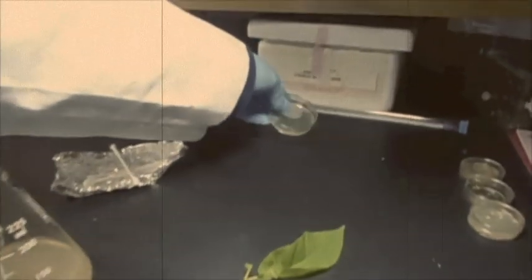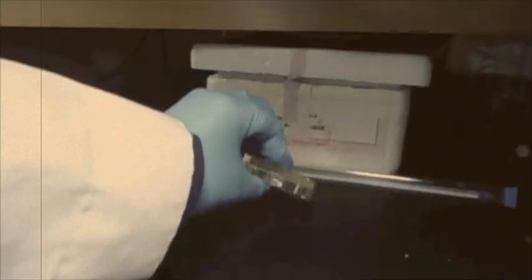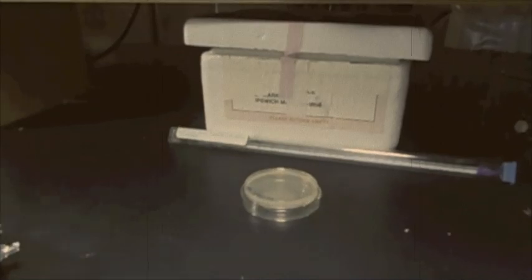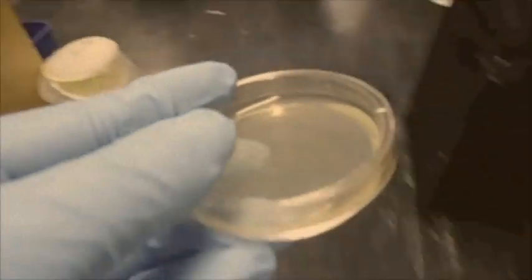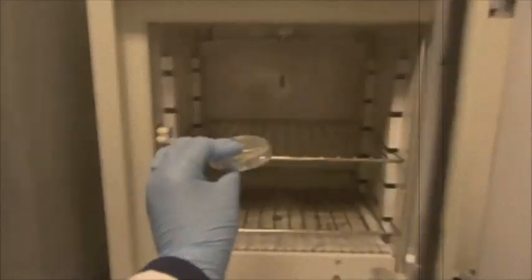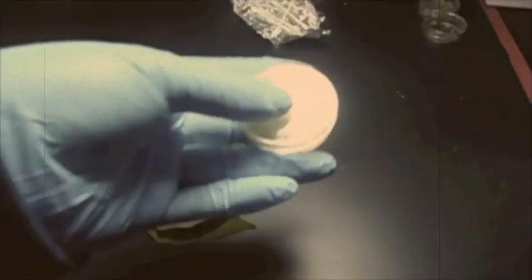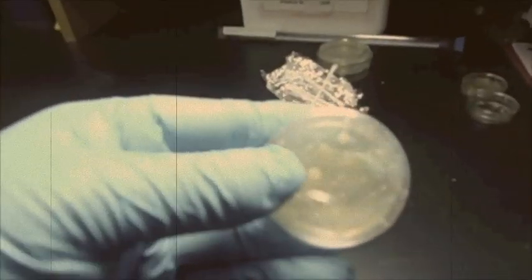That plate is then incubated upside down to prevent condensation, at either room temperature for three days or in a 37 degree incubator for one day. After incubation, you can expect to see bacterial or fungal colonies growing on your plates.